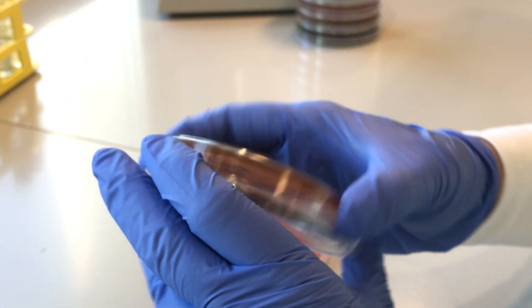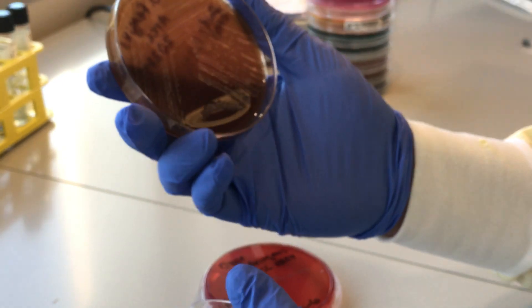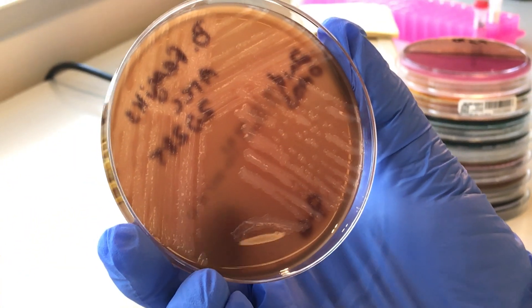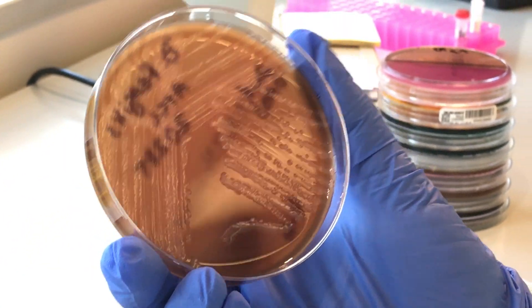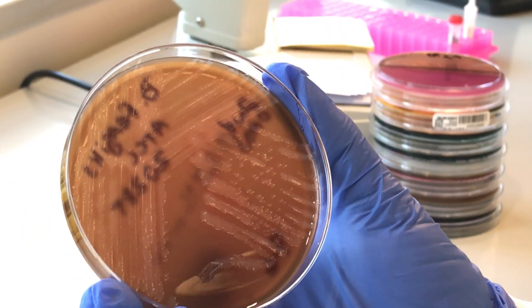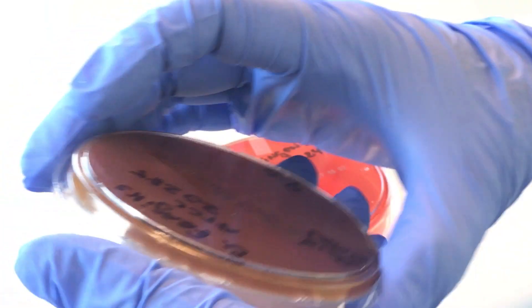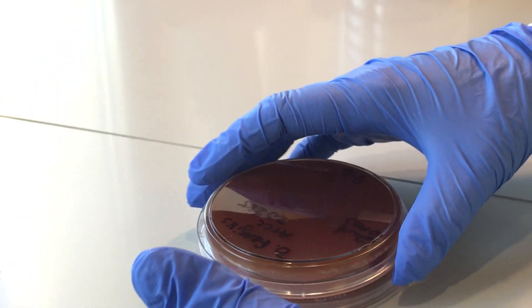And then this is Bacteroides fragilis, which is another anaerobe.